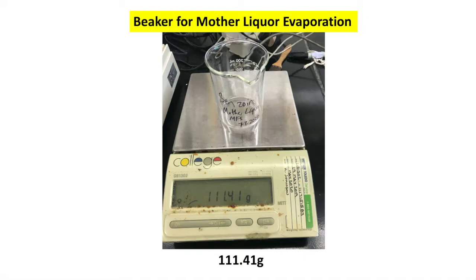It's an easy little experiment to do. Not something you have to write into your reaction table, but if you want, you can jot this number down somewhere on the side of your form, or I'm going to give it to you later.